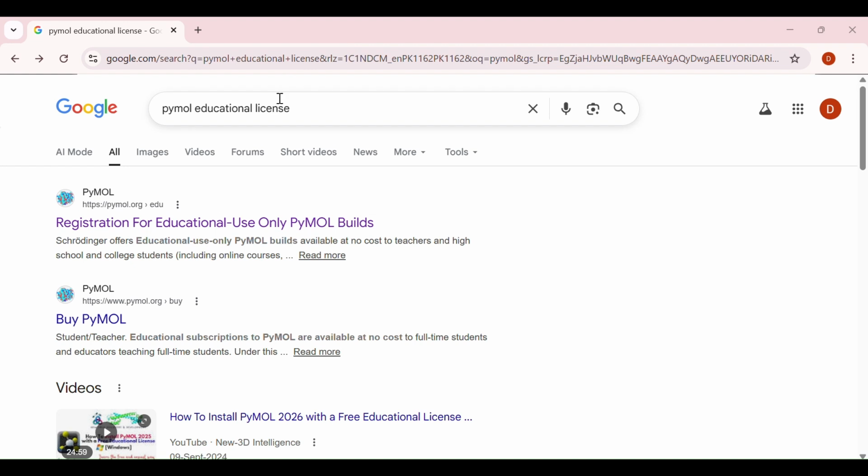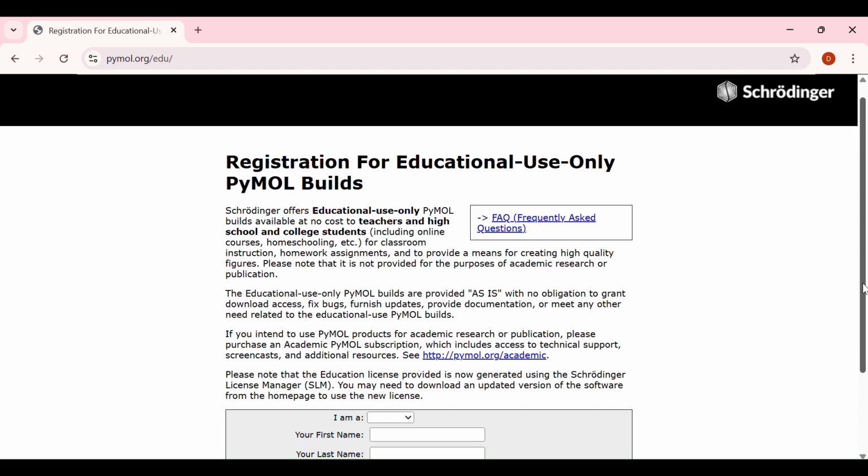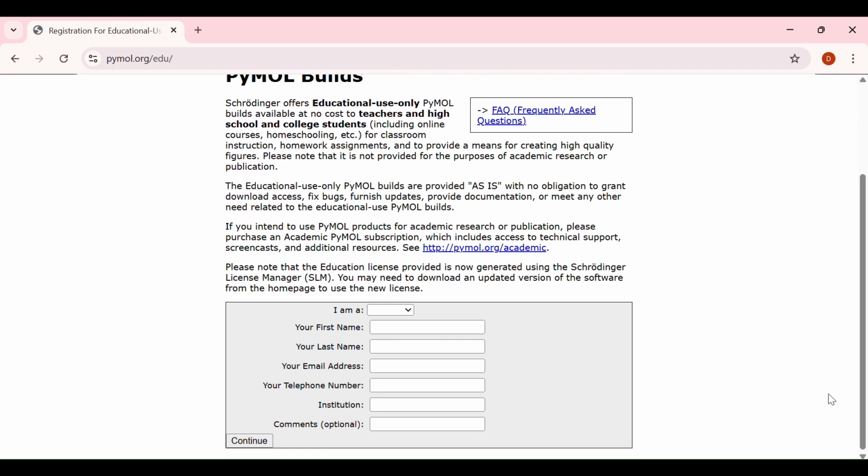First, open your browser and in the search bar, write PyMOL educational license and then click on the first link, which is registration for educational use only PyMOL. Here you just direct it to the official website of Schrödinger. And you can see here they stated that educational use only PyMOL available to teachers and high school and college students at no cost. For this license, you have to fill some of your information, like if you are a student, click on it. Otherwise, you can select the teacher if you are teaching a class.